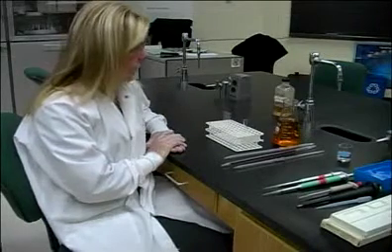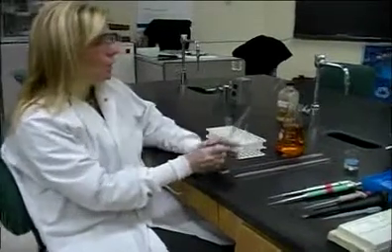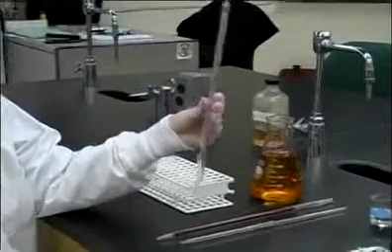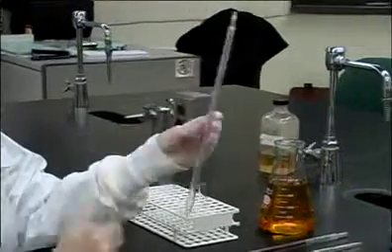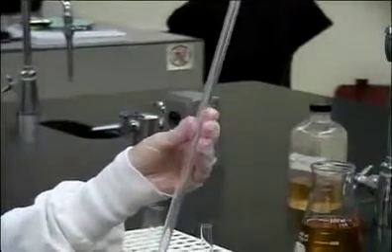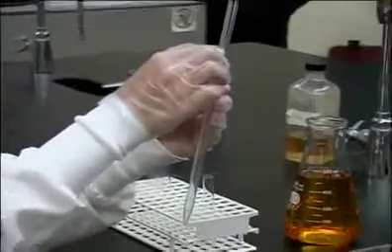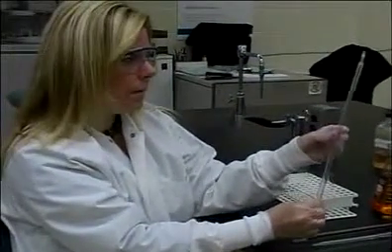One of the first pipettes that we use on a common basis is a serological pipette. And a serological pipette looks just like this, and it is graduated. This happens to be a 10 milliliter pipette. It starts at 0, graduated to 10 down to the bottom of the tip. That means that when you fill the liquid up to the 0 and you dispense all the liquid in the pipette, you are actually dispensing 10 mLs.